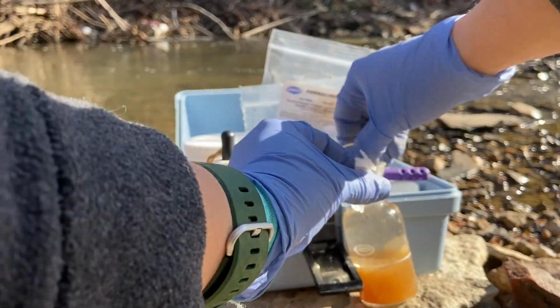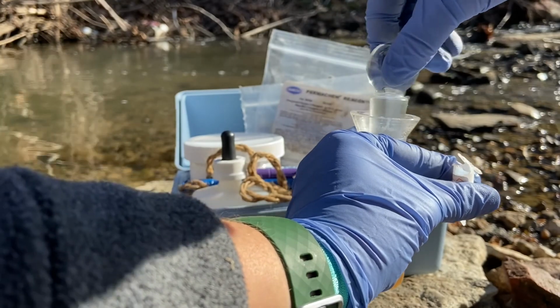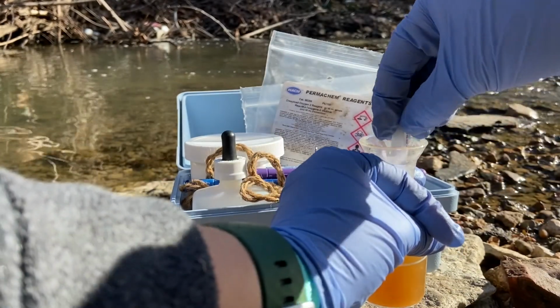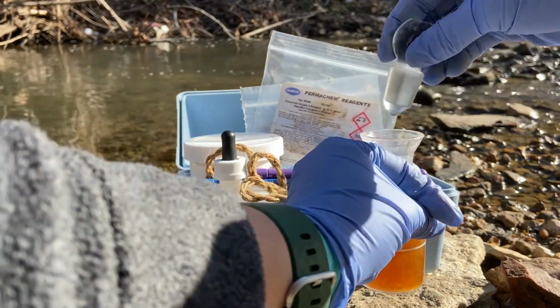An air bubble is also possible after adding DO3, which fixes the chemical reaction. To reduce the chance of an air bubble at this step, you can hold the stopper vertically just above the mouth of the sample bottle, then drop the stopper into place.